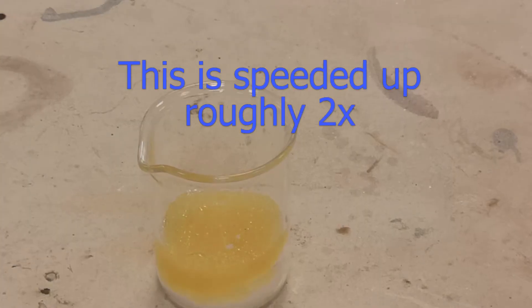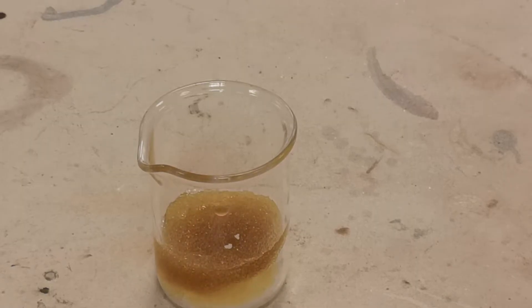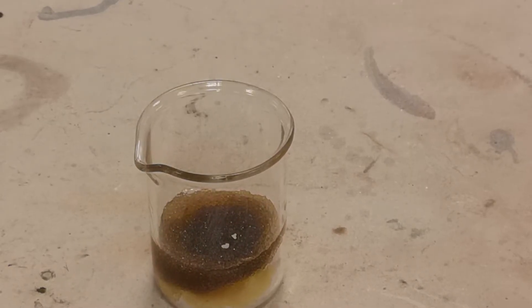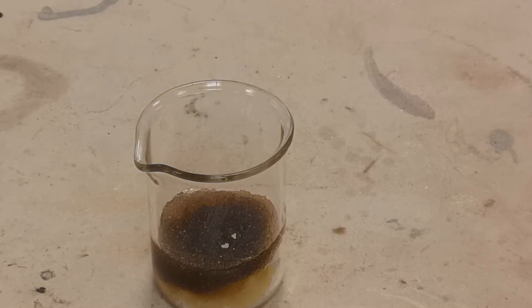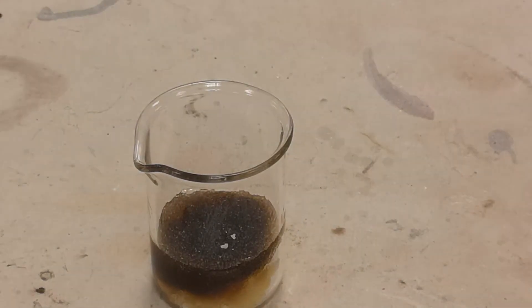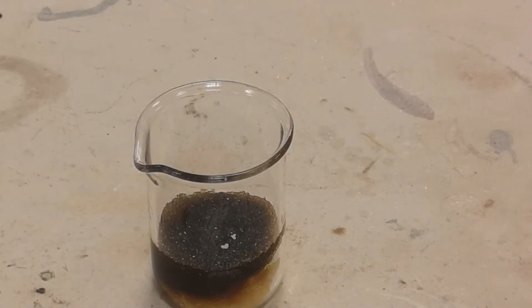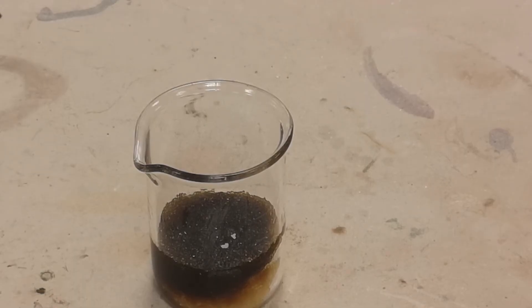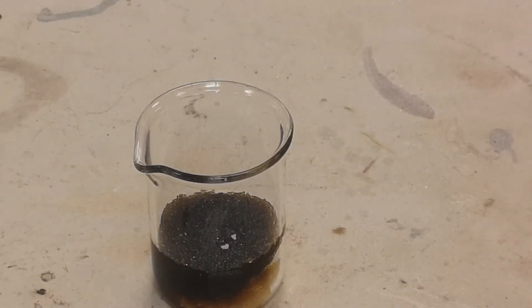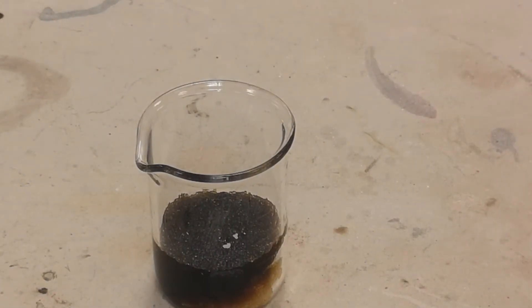At first it seems like nothing is happening, but you will notice that it is yellow on the top, and quite soon you'll see that it starts to get darker and darker through various shades of brown to black. After a couple of minutes you might start to see a small amount of bubbling on the surface, but there is still nothing very exciting.